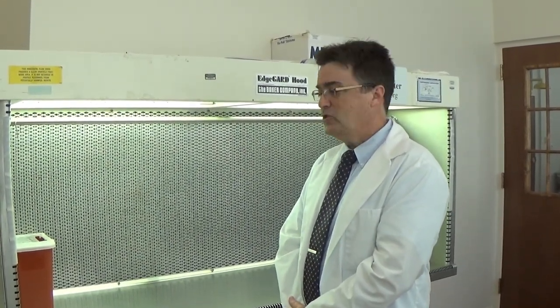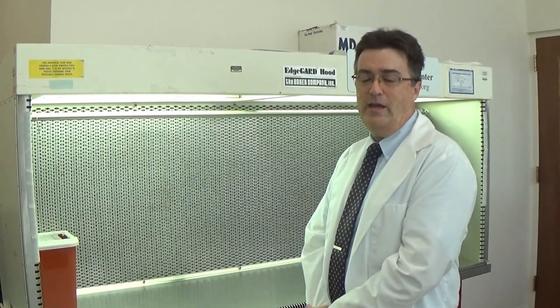Hello, I'm Jeff Hancock, pharmacist from Clinch Valley Medical Center in Richlands, Virginia. I'm here today to demonstrate proper aseptic technique used as it relates to USP 797 and USP 800 requirements.